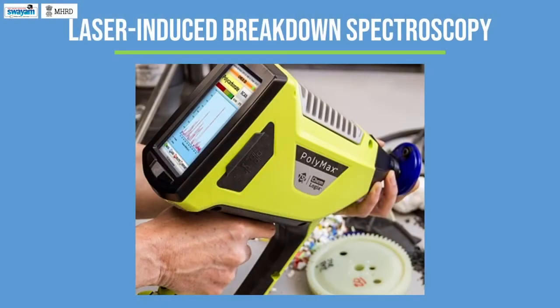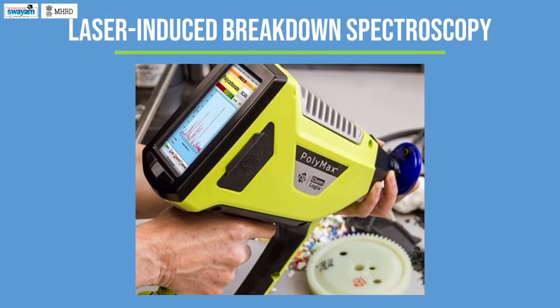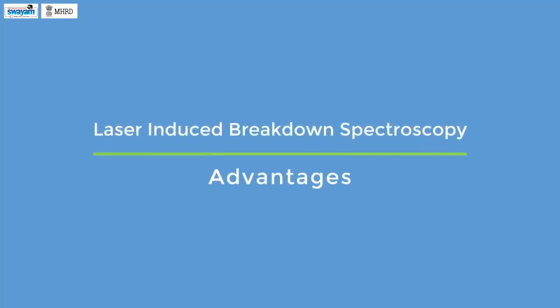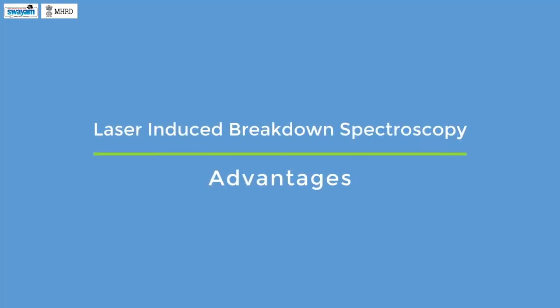This is a portable LIBS instrument which can be taken anywhere for analyzing samples. This is extremely useful for analyzing biomass materials because we need not cut or hurt the plants and trees.